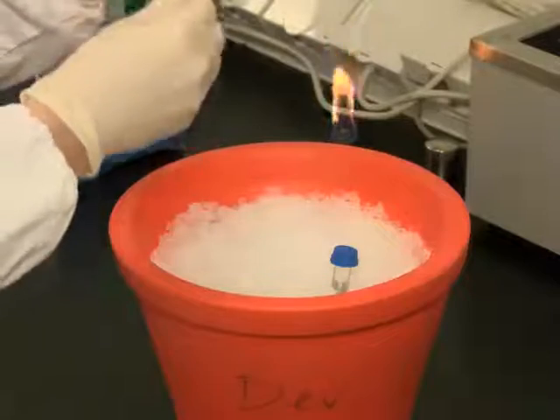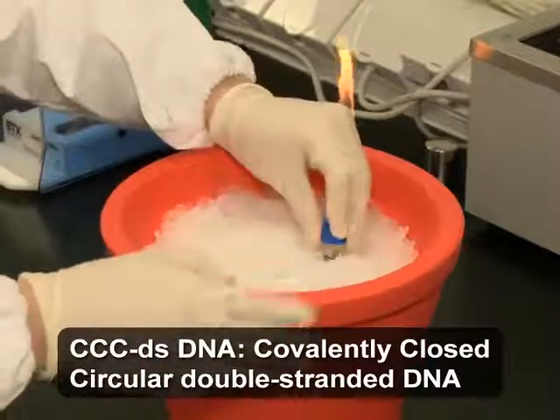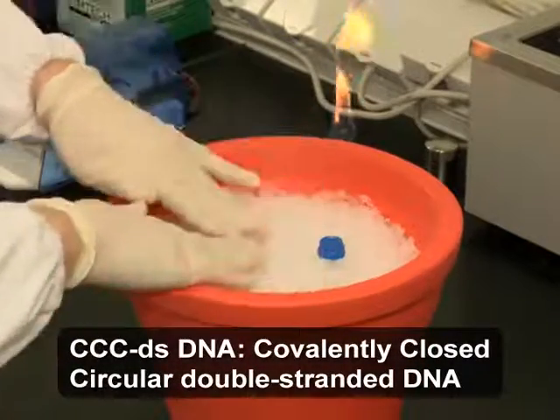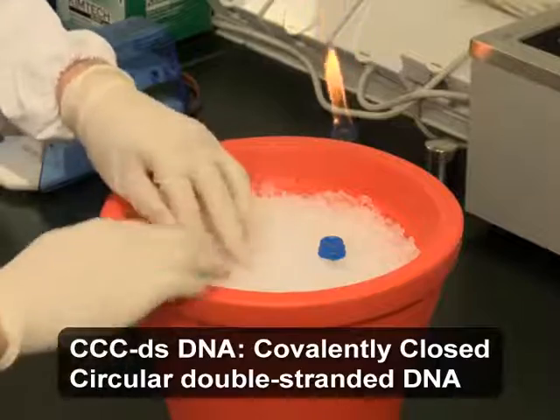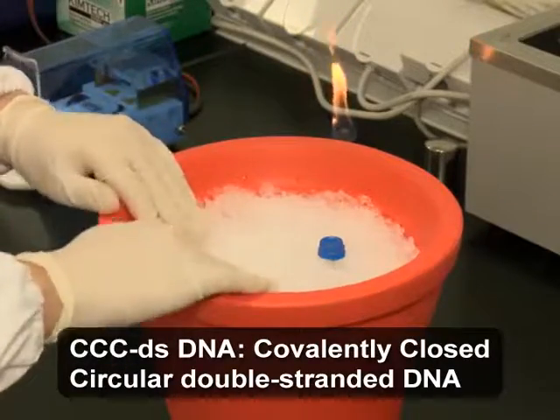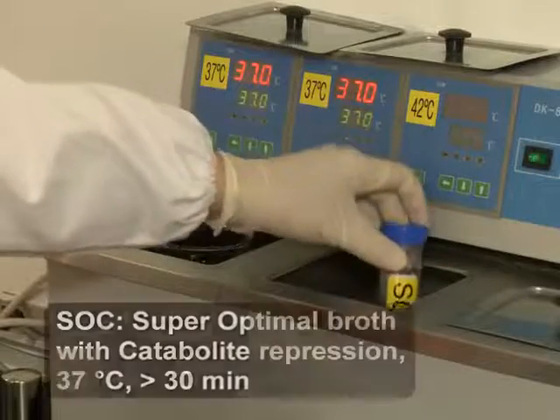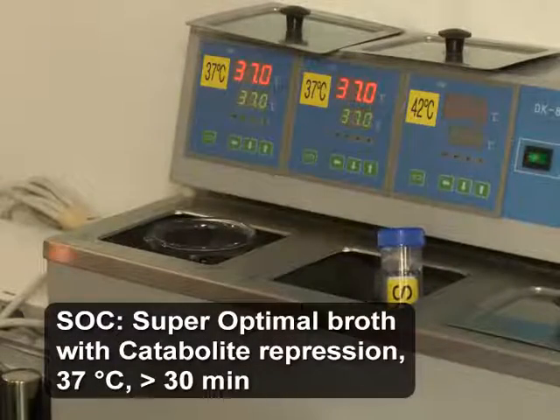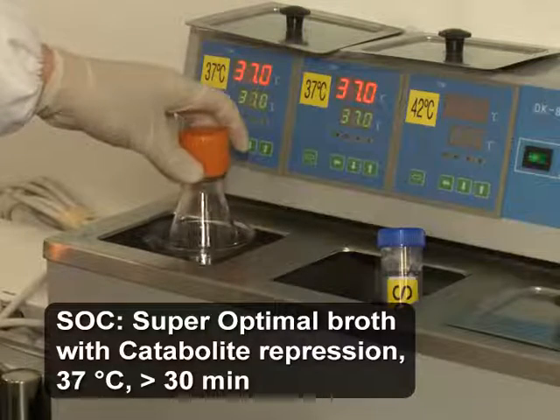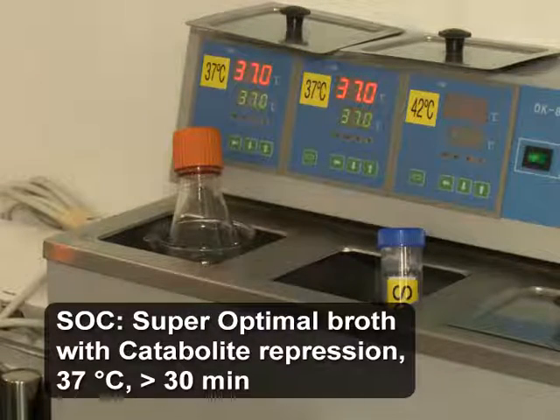To begin this procedure, chill the purified CCC double-stranded DNA in a 1.5-milliliter microcentrifuge tube and a 0.2-centimeter gap electroporation cuvette on ice. Pre-warm 20 milliliters of SoC medium in a 50-milliliter polypropylene conical centrifuge tube in a 37 degrees Celsius water bath for at least 30 minutes.